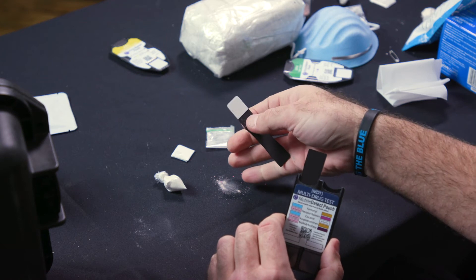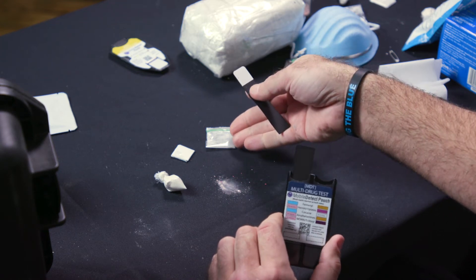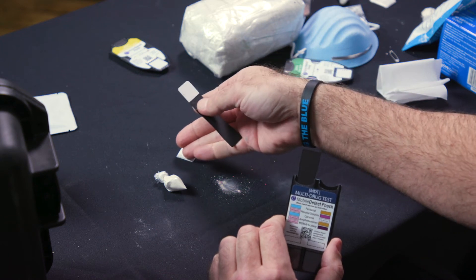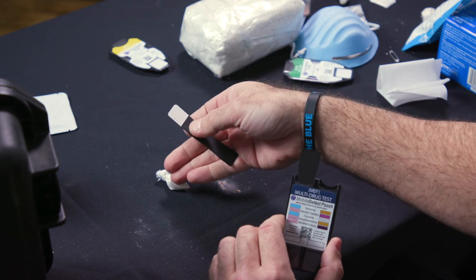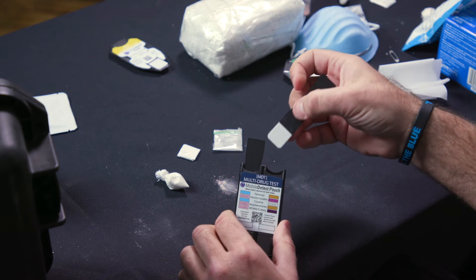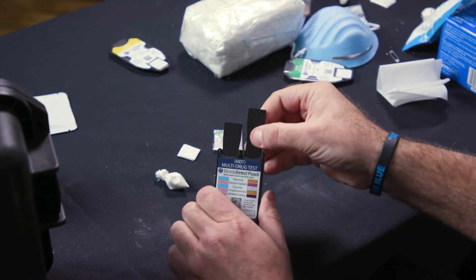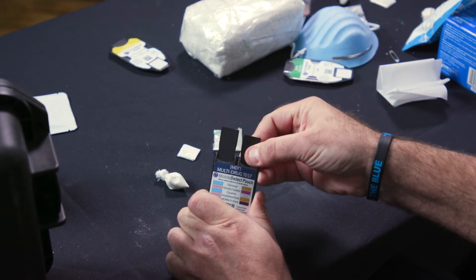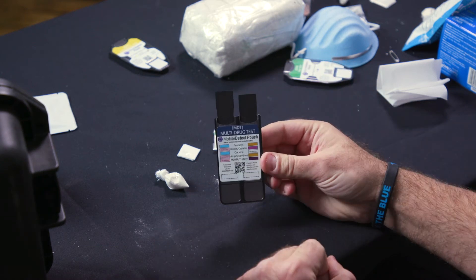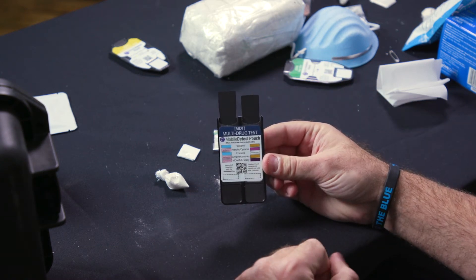You want to swab the same area. This is a dramatic example — this is a bulk amount — but if you had a small ziplock, wax paper, or a corner bag, you could sample with different types of procedures there. Once you've sampled with the second swab, again, you insert it right above the window. When you get to this step here, you're ready to break the reagents and start the reaction.